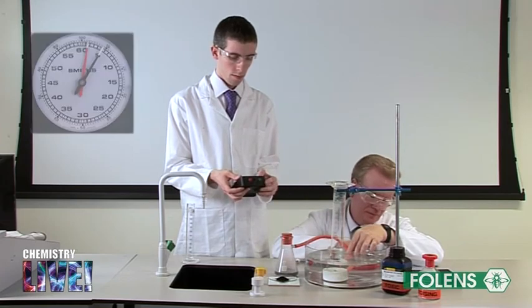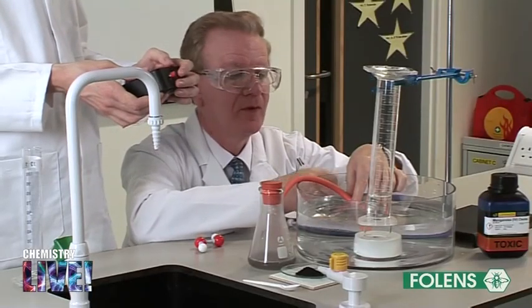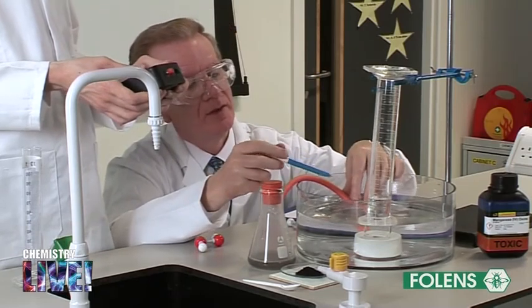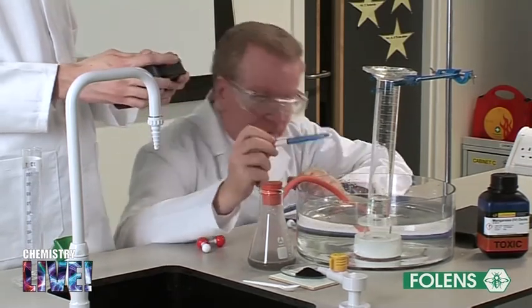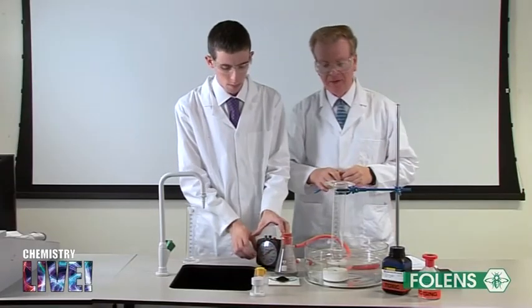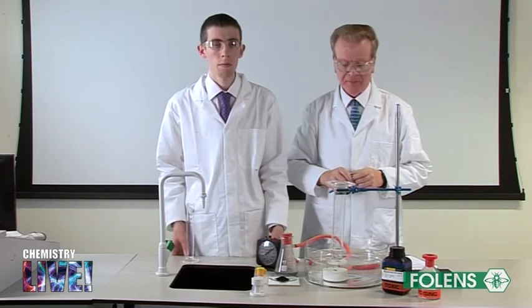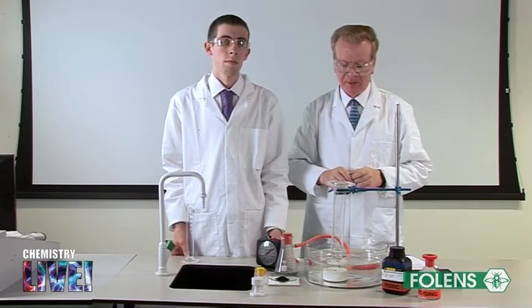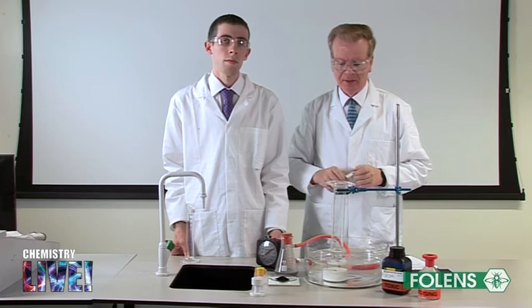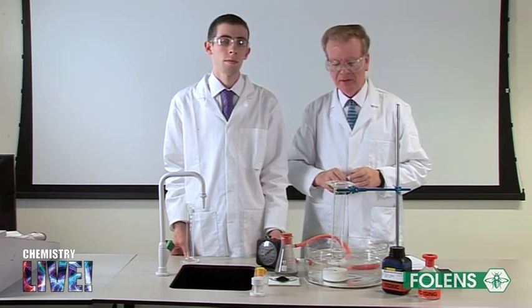300 seconds. Place another 250 centimetres cubed graduated cylinder over the beehive shelf and continue to measure the volume of oxygen gas until the reaction is completed, that is when the volume of gas evolved remains constant.